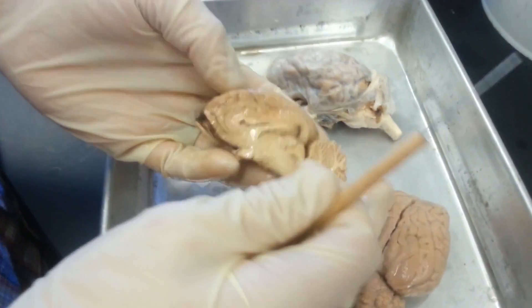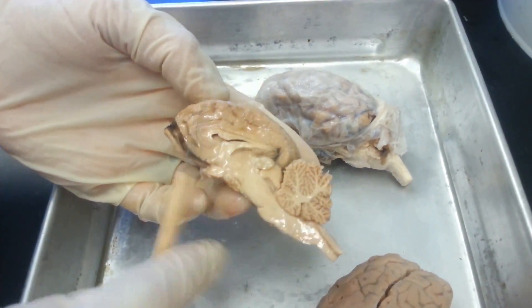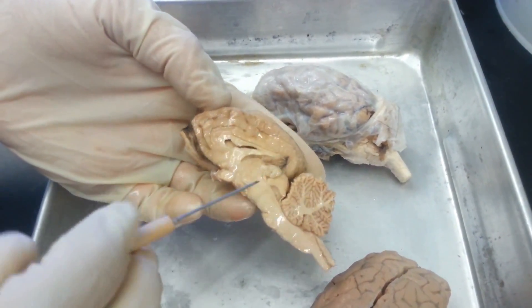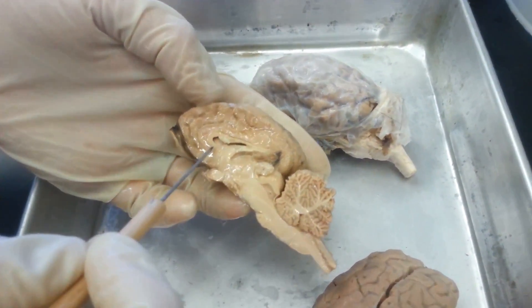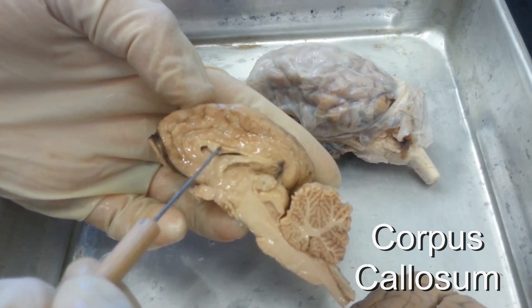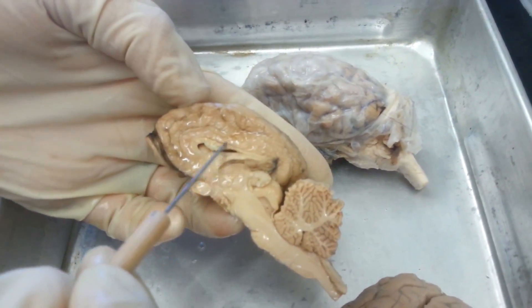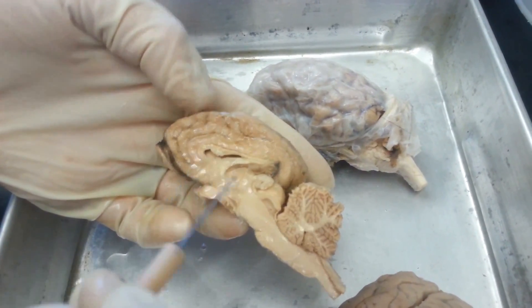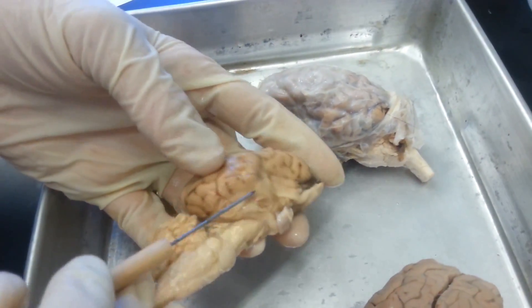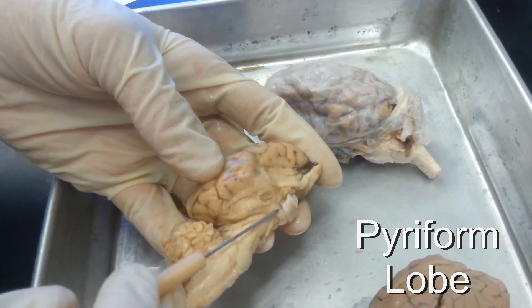When we split the brain in half, there are a lot of structures within the brain to identify. The first is the corpus callosum — it looks like an upside-down Nike sign. And then you have the piriform lobe, which is a lobe on the cerebral hemisphere, the big one on the side.